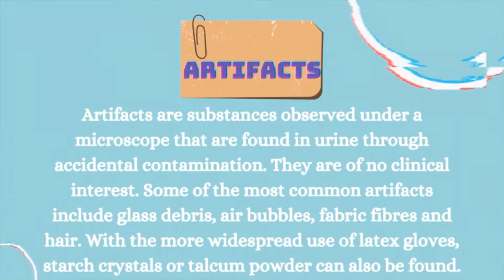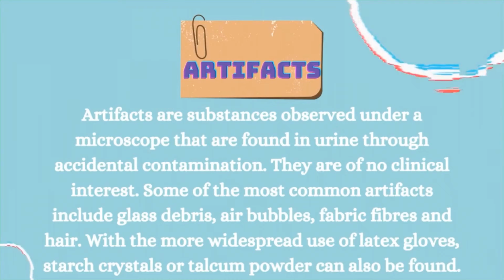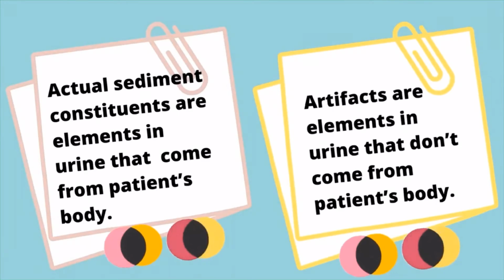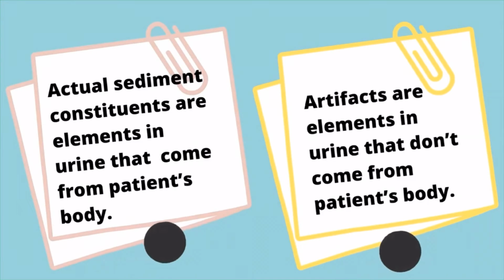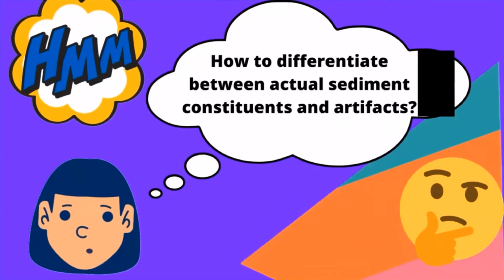Some of the most common artifacts include glass debris, air bubbles, fabric fibers, and hair. With the more widespread use of latex gloves, starch crystals or talcum powder can also be found. Actual sediment constituents are elements in the urine that come from the patient's body. Artifacts are elements in the urine that don't come from the patient's body.